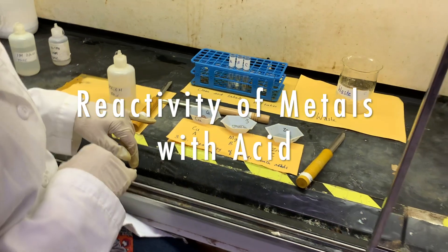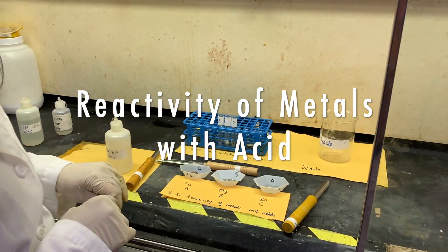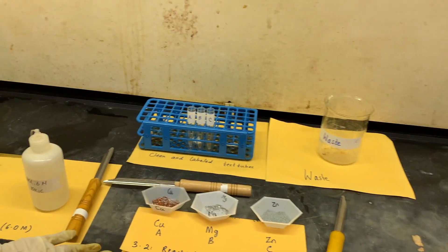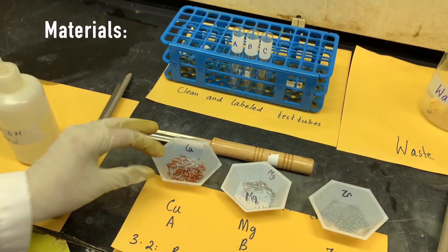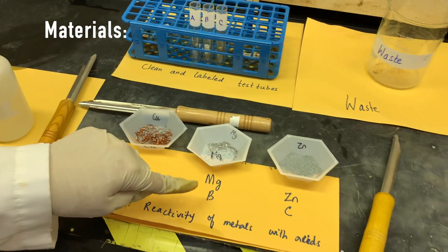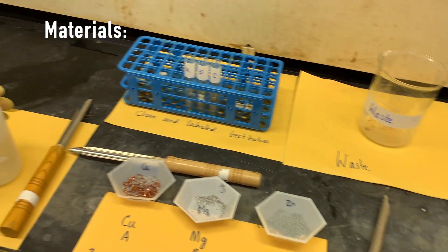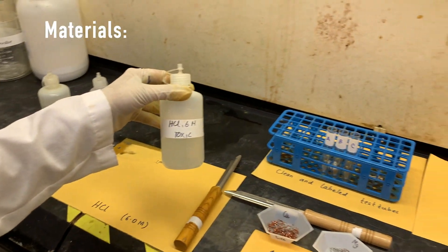Now I'm going to do the reactivity of metal with acid. For this part we have copper, this is A. We have magnesium B, we have zinc C, and this is hydrochloric acid.